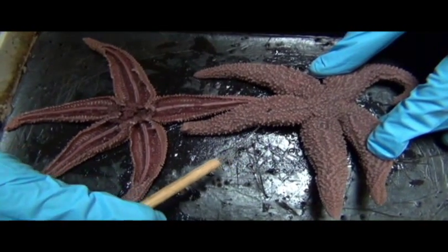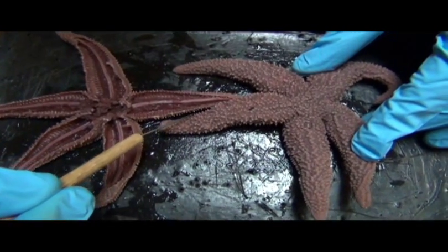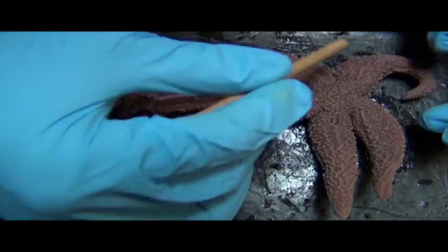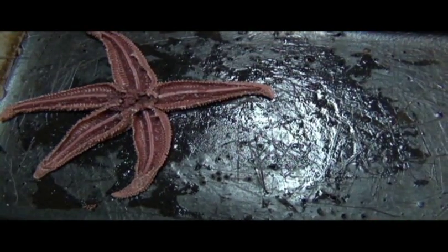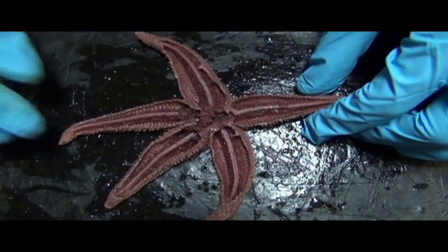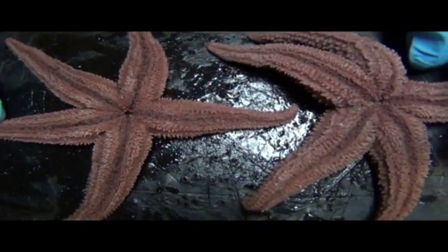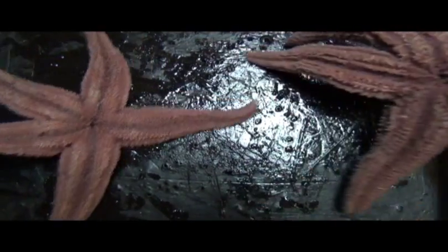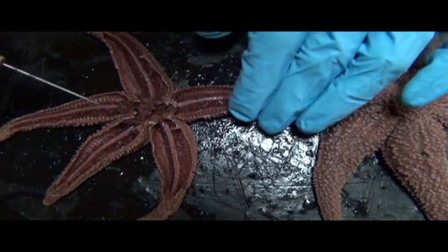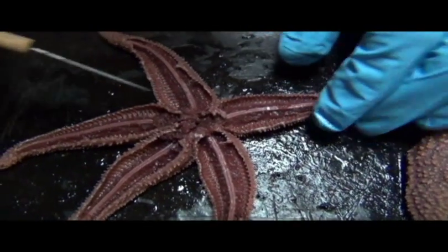The student meticulously and very intricately removed the top half of each of the arms. And so what's since been exposed now is this. And so this is the aboral surface. The oral surface looks just like the oral surface of an intact specimen, stomach in the center. Okay, but the aboral surface is different because it's had its top half removed. The madreporite, you can't really see it because it's been removed intentionally.